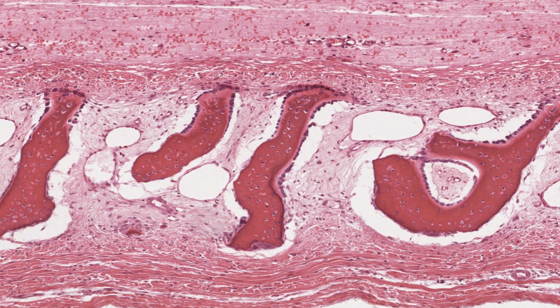Look at this bone spicule. It's got no embedded blood vessels, Haversian systems or lamellae. The osteocytes are embedded in a very haphazard way, but will maintain contact via their thin cytoplasmic processes within the matrix canaliculi. This is fast-growing embryonic or woven bone.